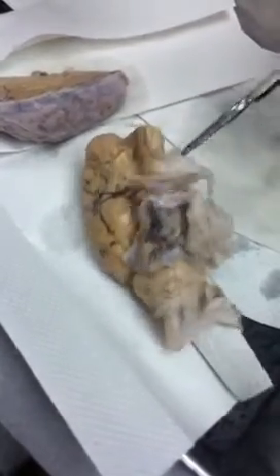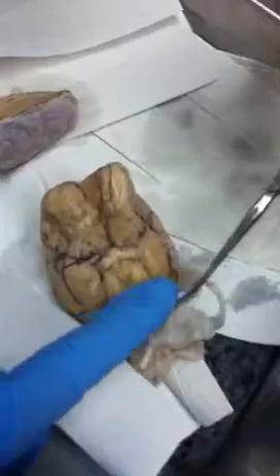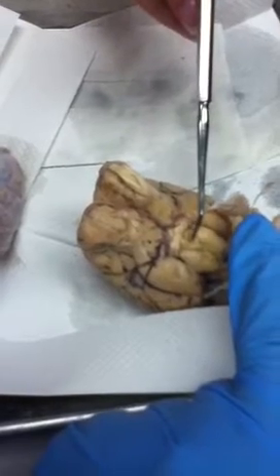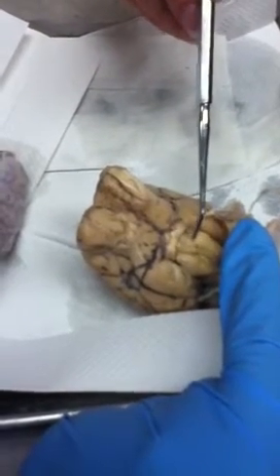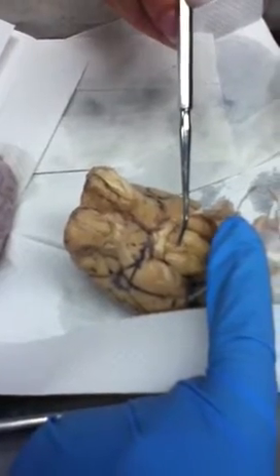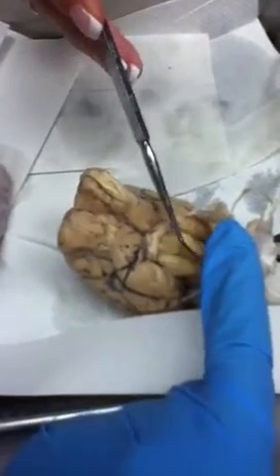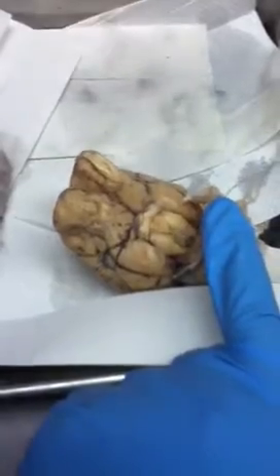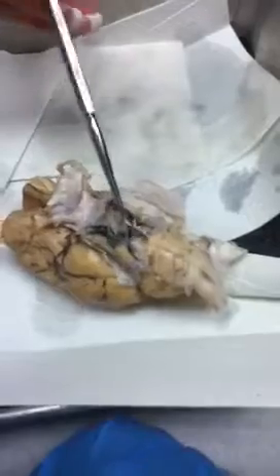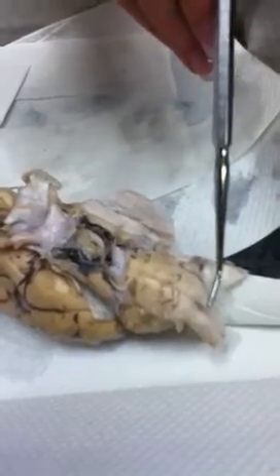If I lift this up, can you hold it? Yep, you should have oculomotor nerves right here on the cerebral peduncles, and right here in the center of the cerebral peduncles, the mammillary body. Thank you. Mammillary body. I was going to say mammary gland, and I knew that wasn't right. I blame you guys. Okay. From there, in the back, you have the pons, the medulla oblongata, and the spinal cord.